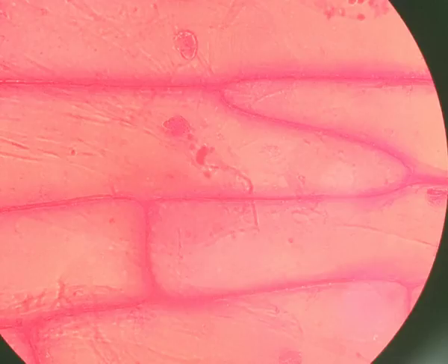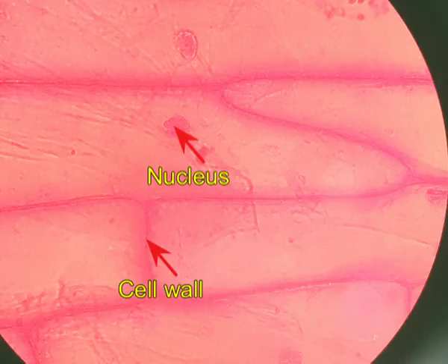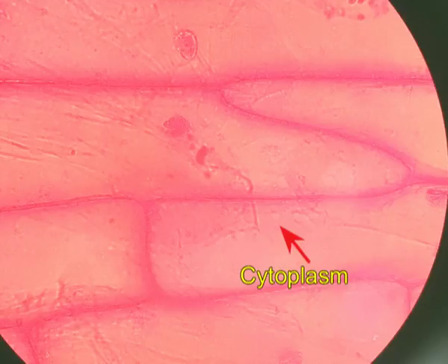How do we identify and confirm that the cell we are observing is a plant cell? Plant cells have a tough outer cell wall, their nucleus is not in the center but towards the side, and they are very tightly packed without any intercellular space between them. So today we have learned the procedure of making a temporary mount of onion peel and how to observe and study the structure of a plant cell. Thank you, dear students.